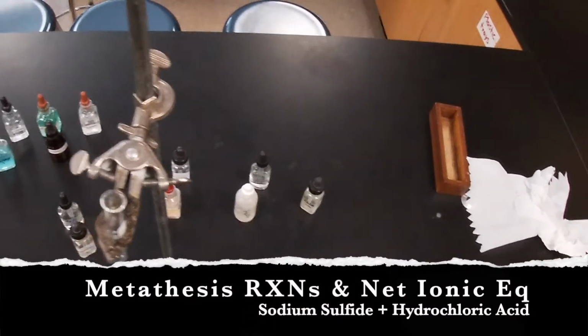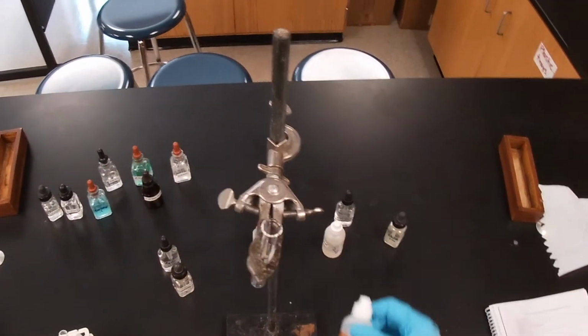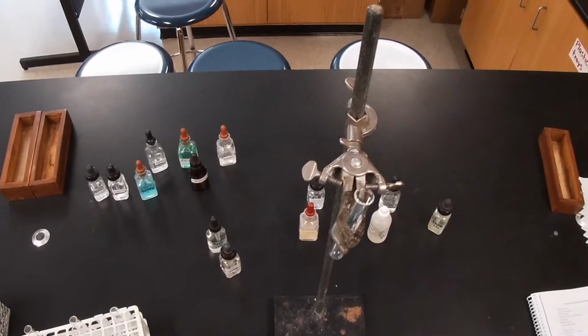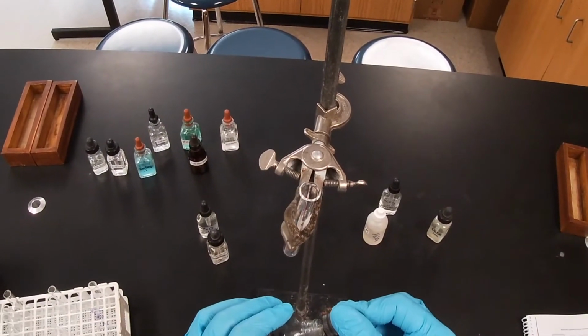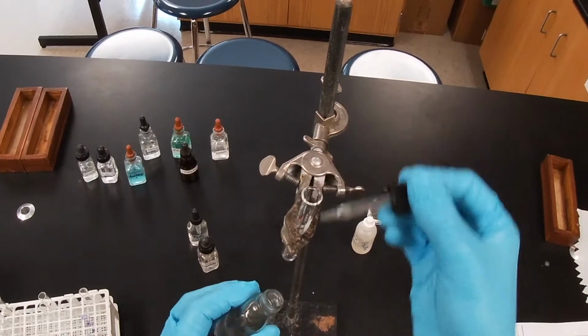Reaction 13 is going to be between sodium sulfide, hopefully you can see it, and hydrochloric acid, hopefully you can see that. And we got our test tube set up. We're going to go ahead and add a dropper full of our sodium sulfide. Add some more.